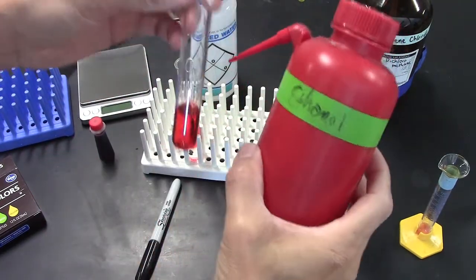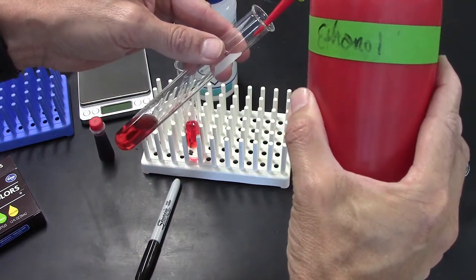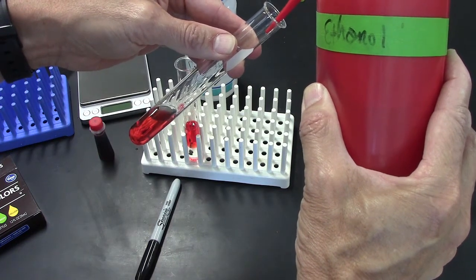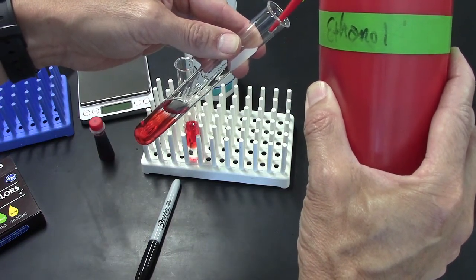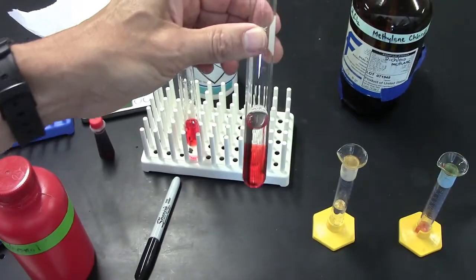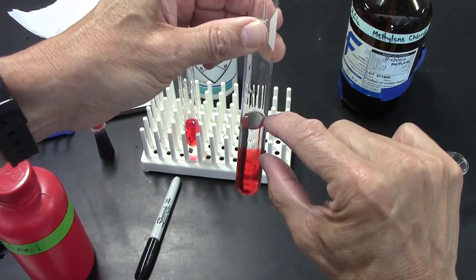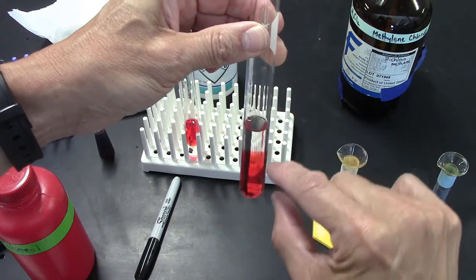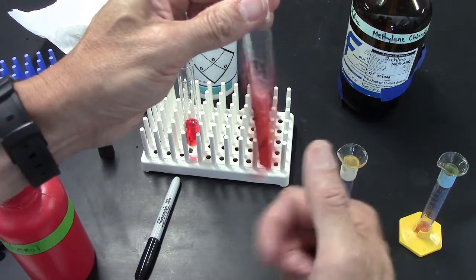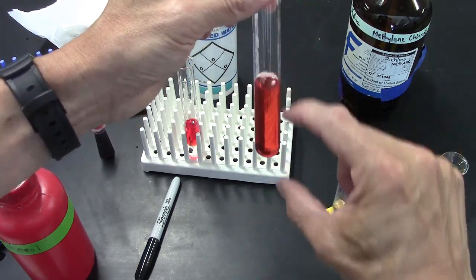Here, I'm going to use ethanol. Ethanol is a lower density than water. And so I'll trickle some down the side here. And here you can see the red layer on the bottom is the water, the clear layer on top is the ethanol. But now if I shake this one, it won't separate into two layers.